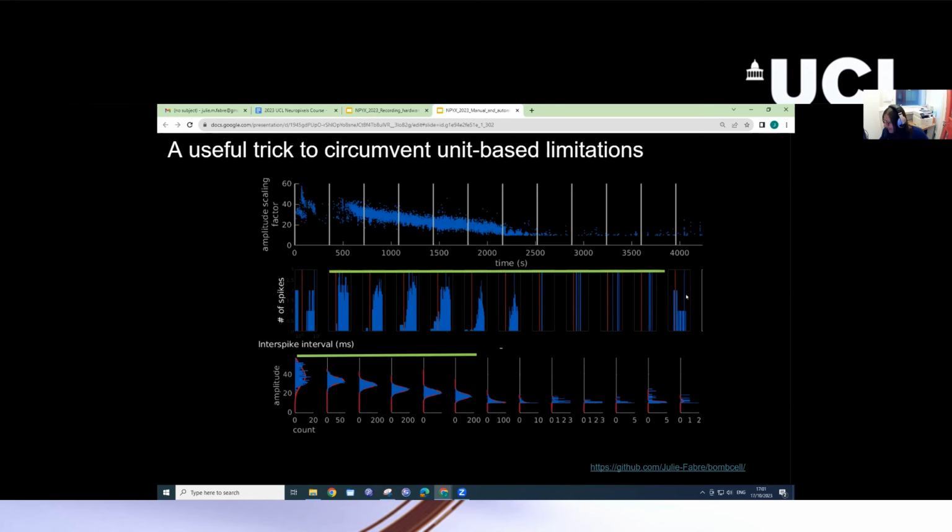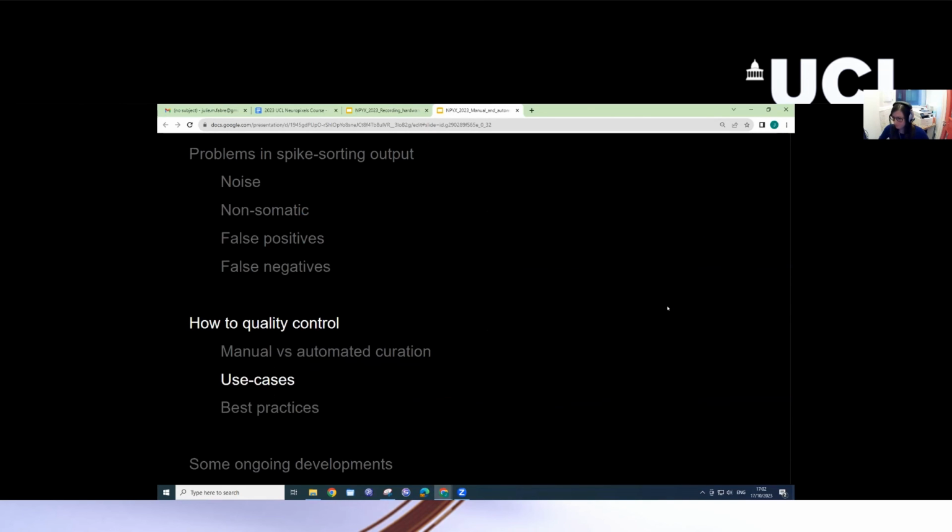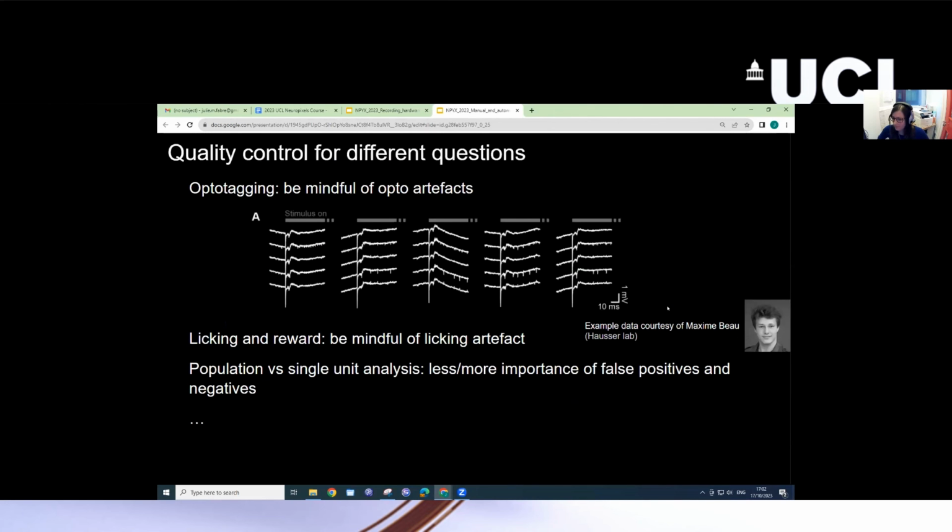Here, there's perhaps not enough data to say much. And similarly, you can see here that if you try and estimate how many spikes are below the spike sorter's detection threshold, these bins are good. So you would be able to select certain time bins for this unit that are good and use these in your analysis, and discard any time bins where perhaps there's contamination or there were large amounts of drift and this unit is no longer present. I see I'm slightly running out of time, so I'm going to hurry up.